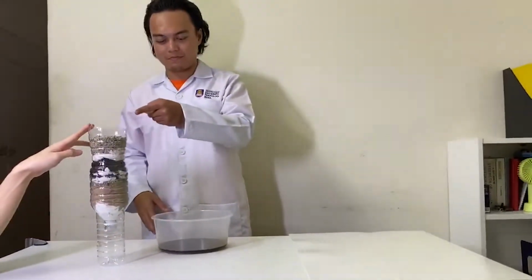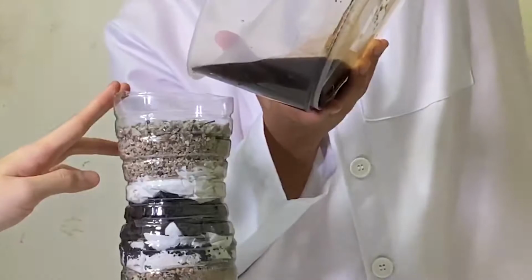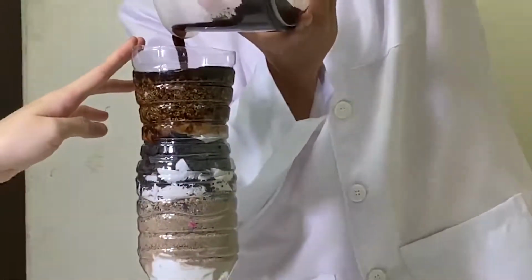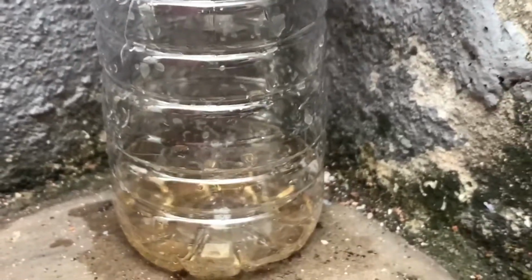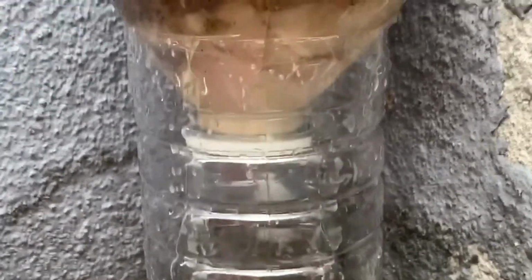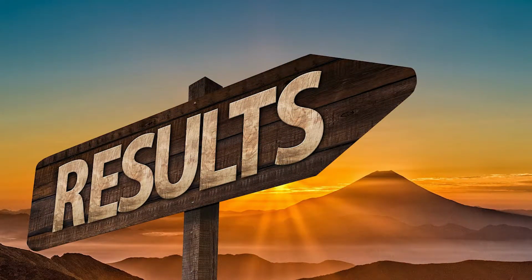Hi, for the testing phase of our filtration model, we have chosen several samples from different sources. For this example, we want to test the filtration compatibility of our model with our sample, which is industrial water that we have chosen. This sample is then poured into the model and let run through the filtration process. This will take some time until we can see a slow dripping water droplet, which indicates the filtered sample. The outcome of this process will then be collected at the bottom of the bottle. Then repeat the process for other examples and the results have been recorded.